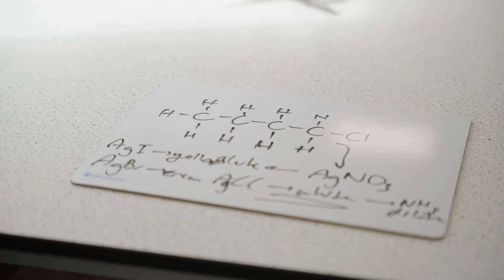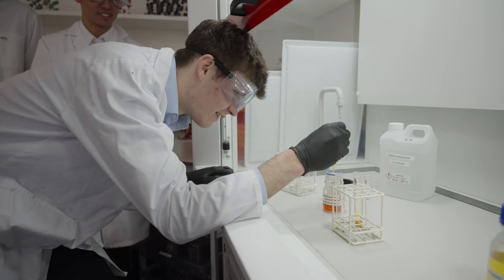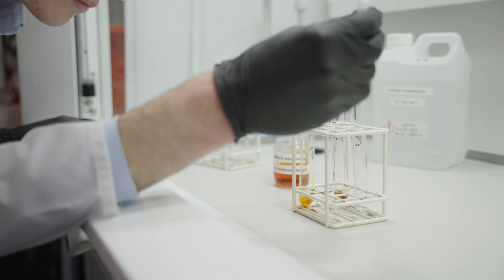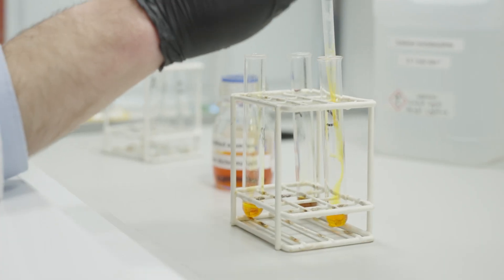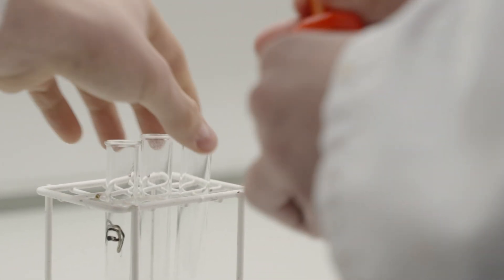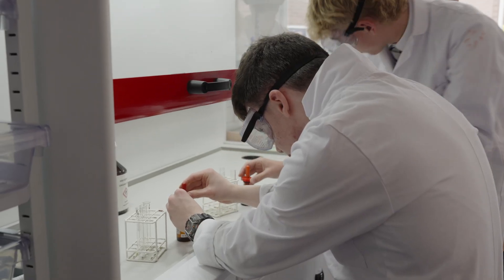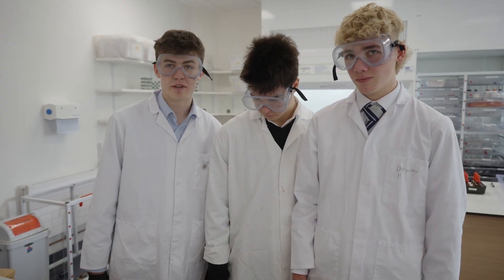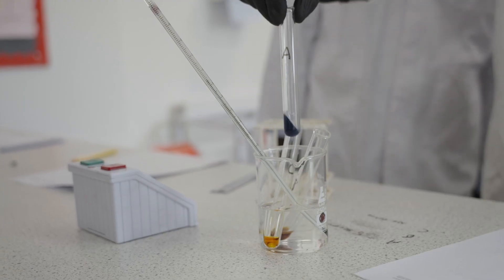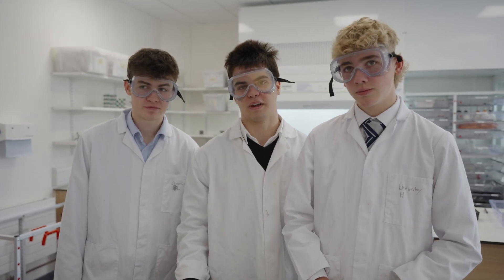We have three different organic liquids which we're trying to determine — which is which. We're doing a series of tests and recording the observations that we see. We've added one centimeter cubed of potassium dichromate acidified, and what we'll do is with some of these compounds that will change the colour of them when you put them in a water bath. We know that potassium dichromate reacts with an alcohol, and we see that A turned from orange to greenish blue, so we know that A is some form of alcohol.